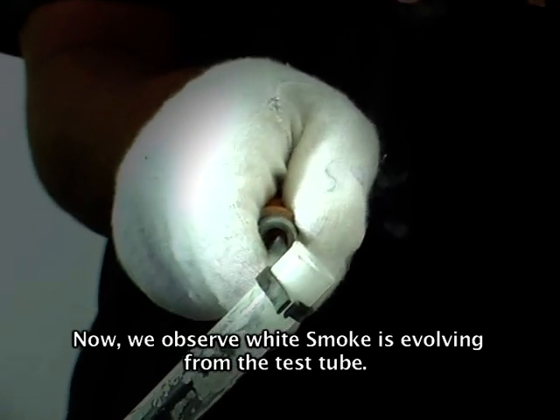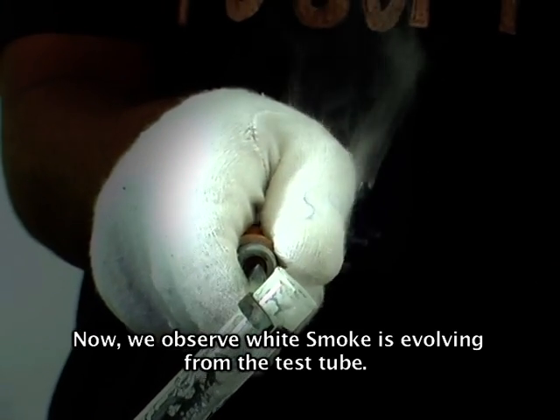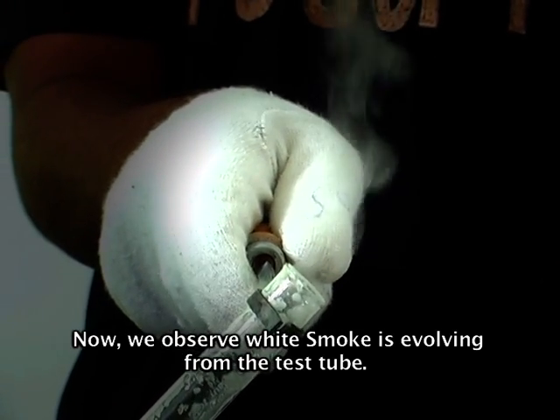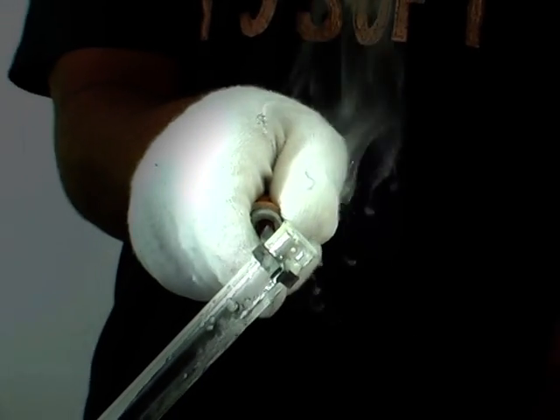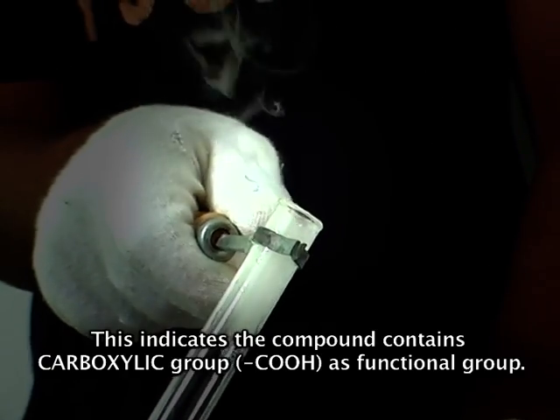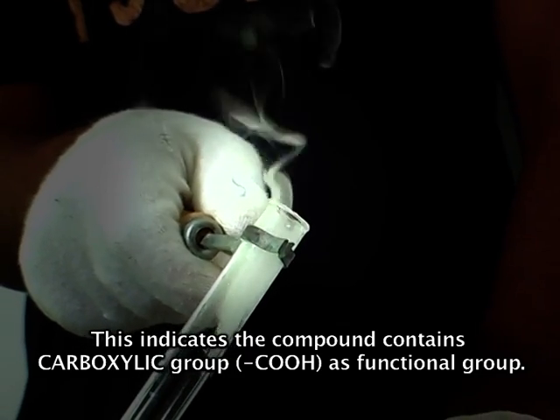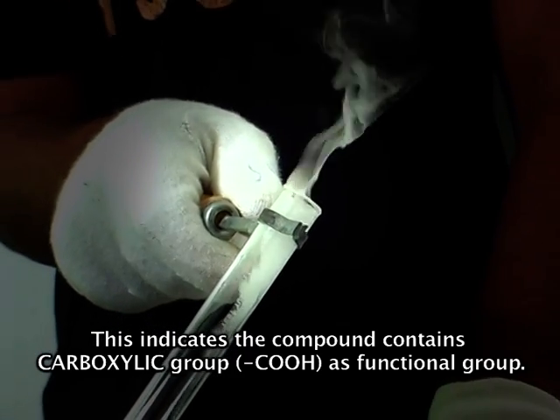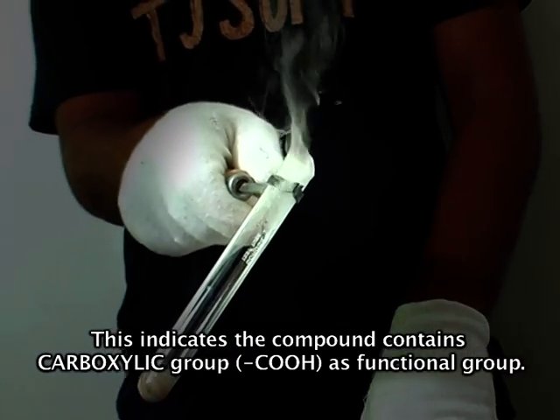Now we observe white smoke is evolving from the test tube. This indicates the compound contains a carboxylic group as its functional group.